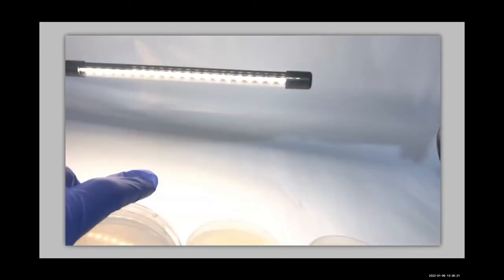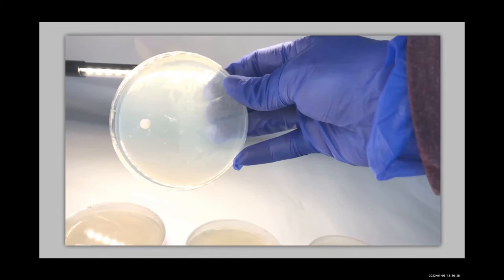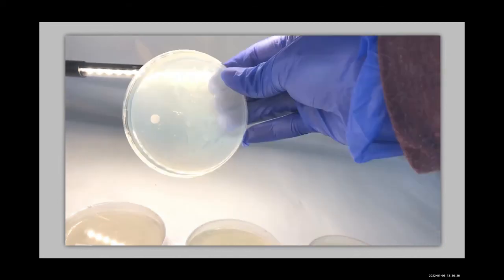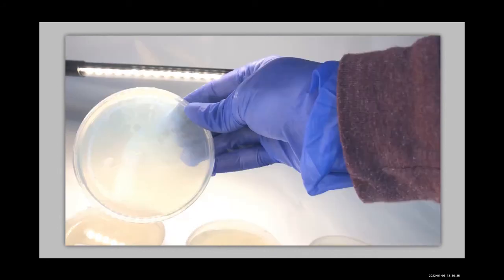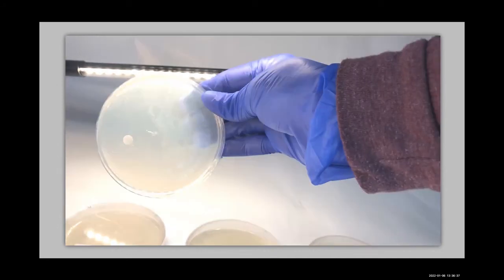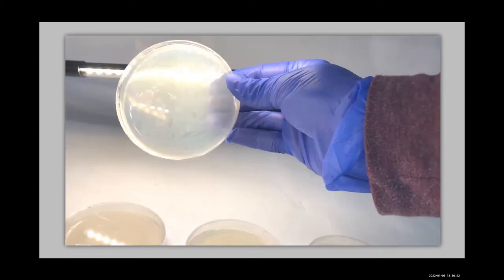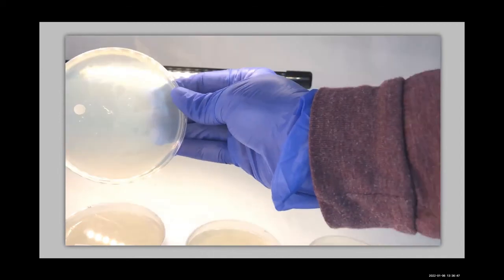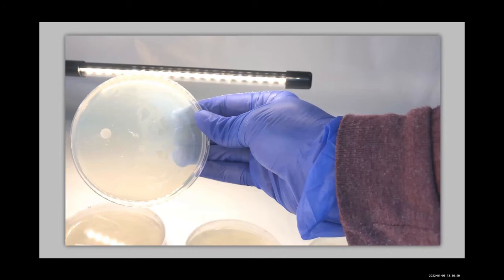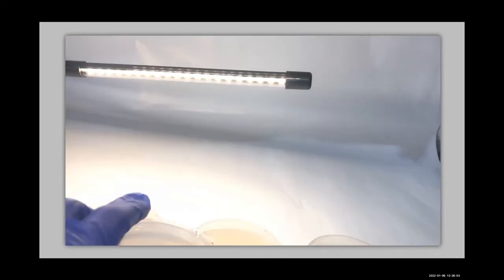And let's have a look at our staph exposed to the clindamycin. I'm going to get you the right angle here. What do you see here? I see a huge clearing, really big. Goes almost to the center of the plate. So this is a very effective antibiotic for staph infection.